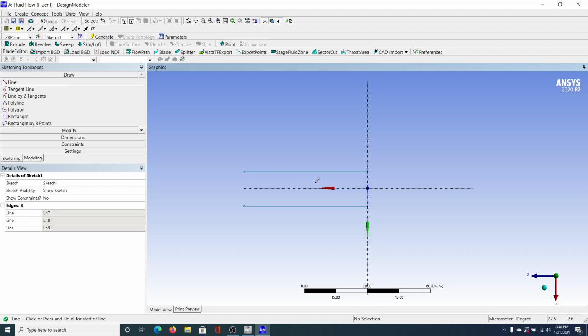This is the mixing chamber. It's the first thing we created. So right now we're just getting a rough overview of the design. So I'm going to make this the inlet for the one, and the inlet for the other.